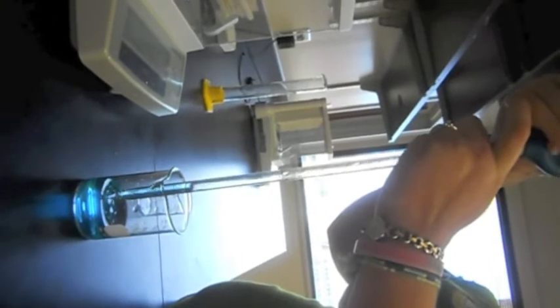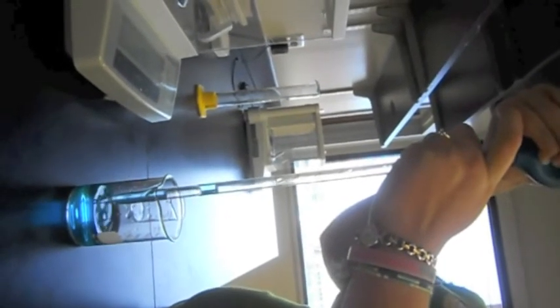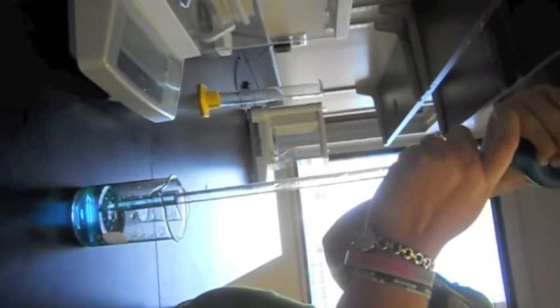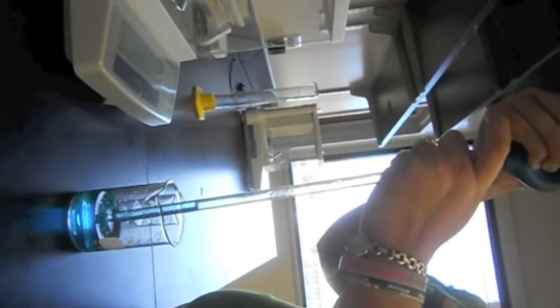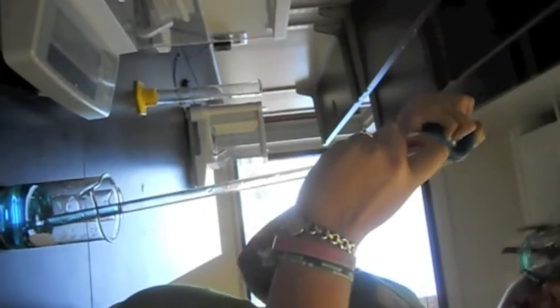Slowly release the ball to allow the water to go into the pipette. Make sure you don't get air bubbles. When you let go of the ball, place your forefinger on top of the pipette holding in the water.